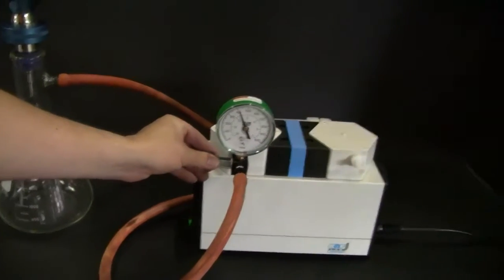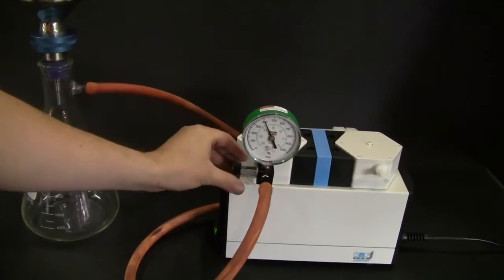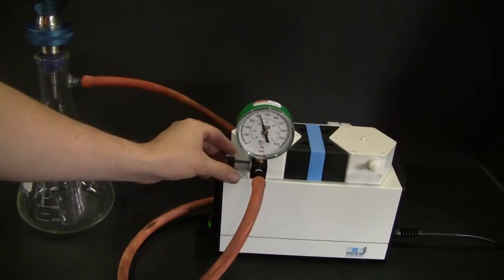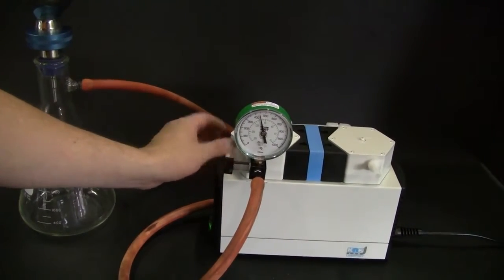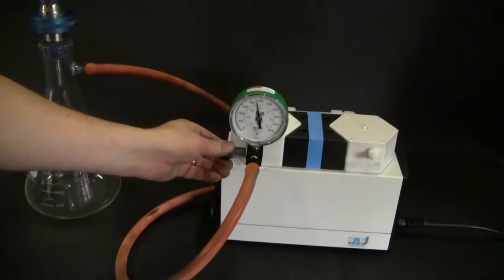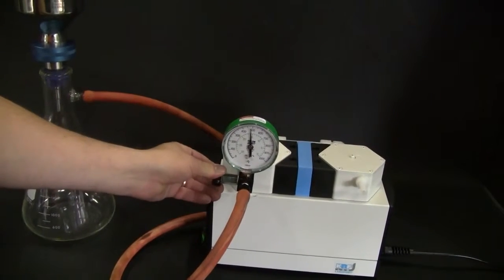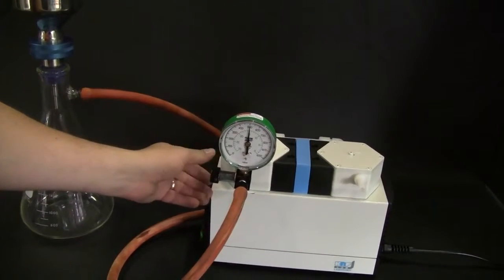So I can pull it down, but then I can adjust it back. That little whistling noise is the air coming out, and I think that's lovely.